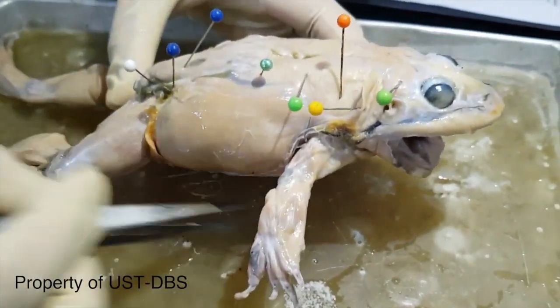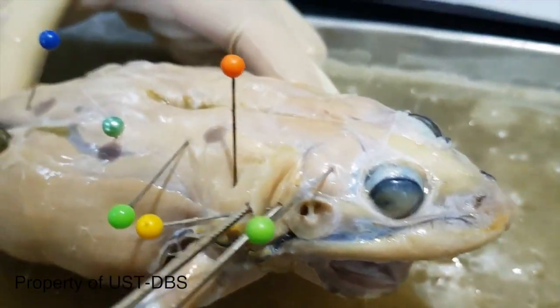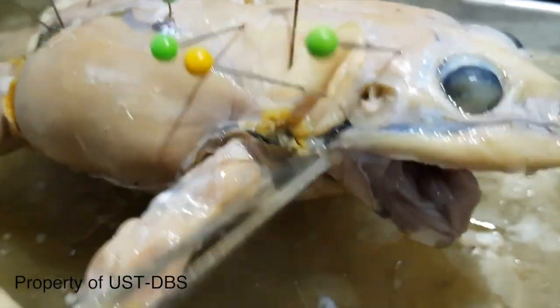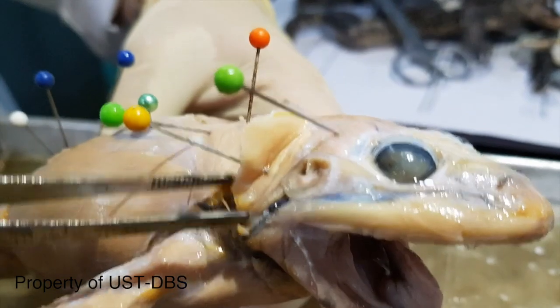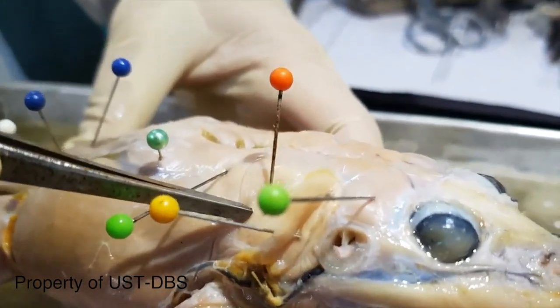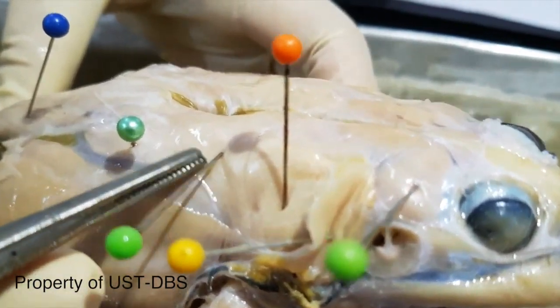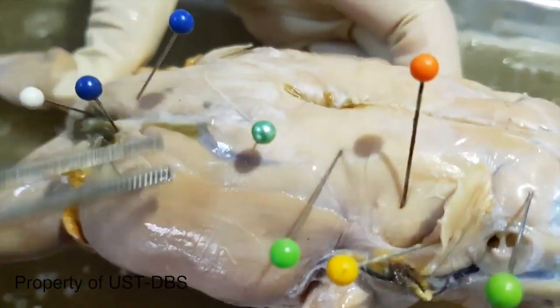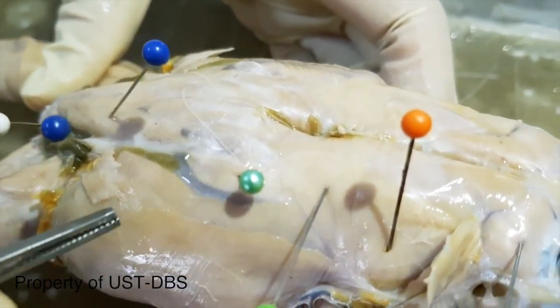Okay, so just to go over: temporalis, depressor mandibularis, going to trace it, it goes towards the mandible. Then this one here is the dorsalis scapula. Then longissimus dorsi, the iliolumbaris.